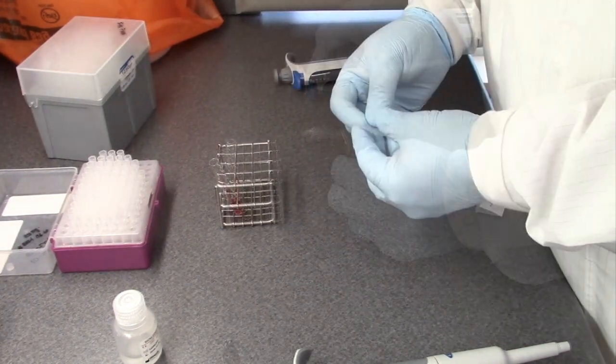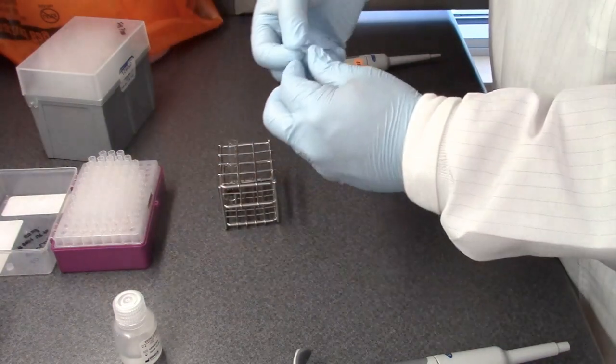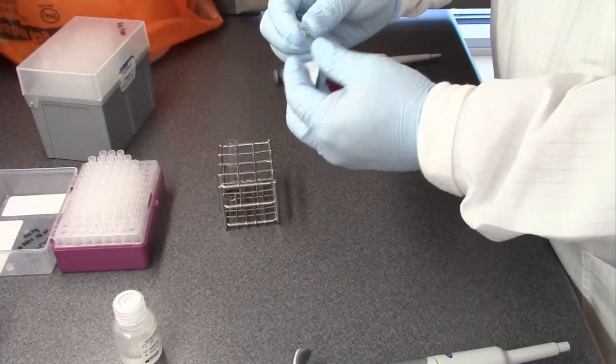Cover the tube with parafilm and mix gently by inversion. Allow the tube to stand at room temperature for 6 minutes.